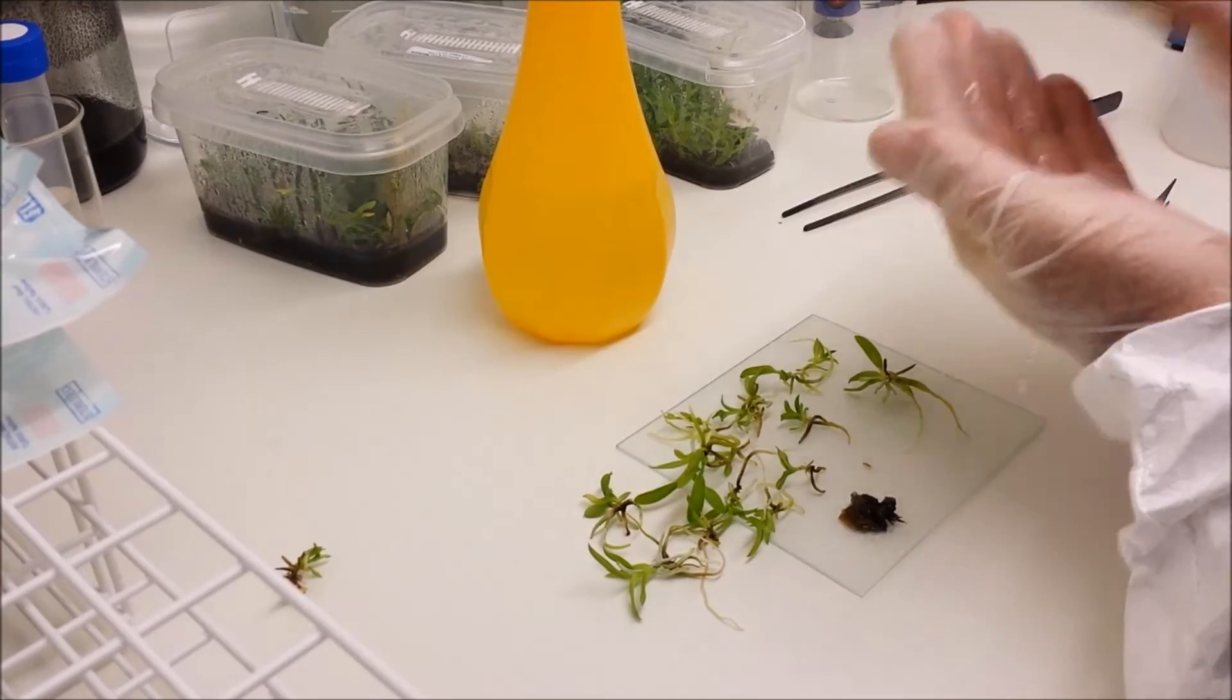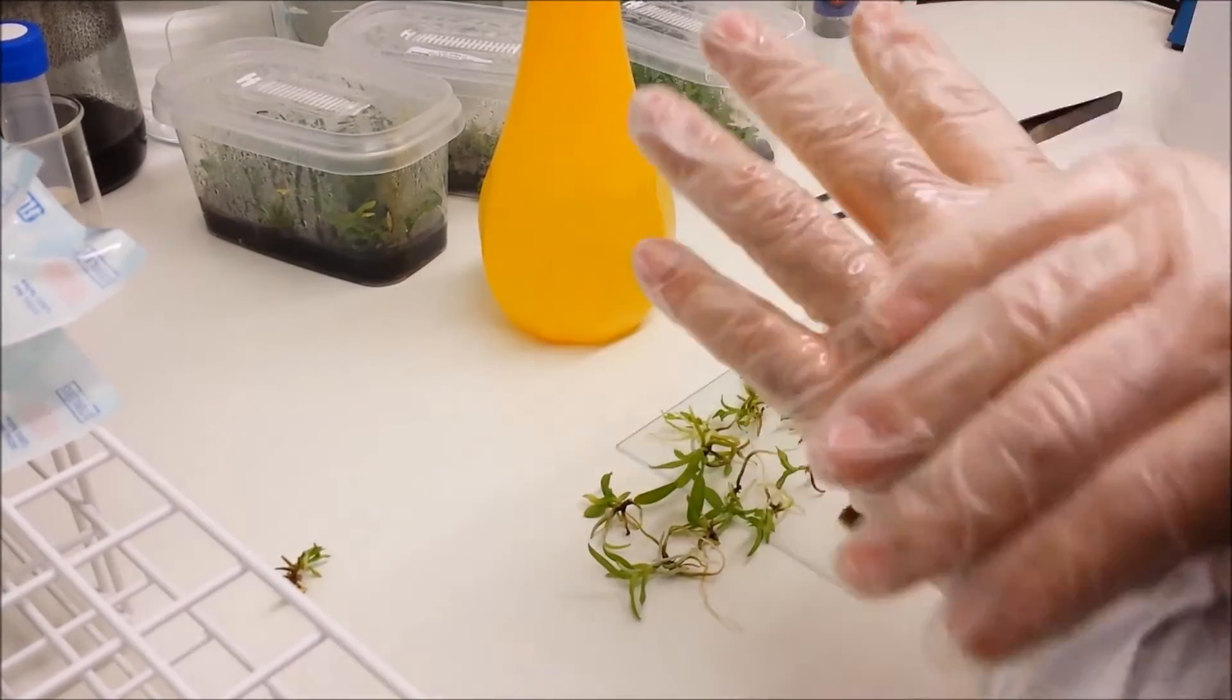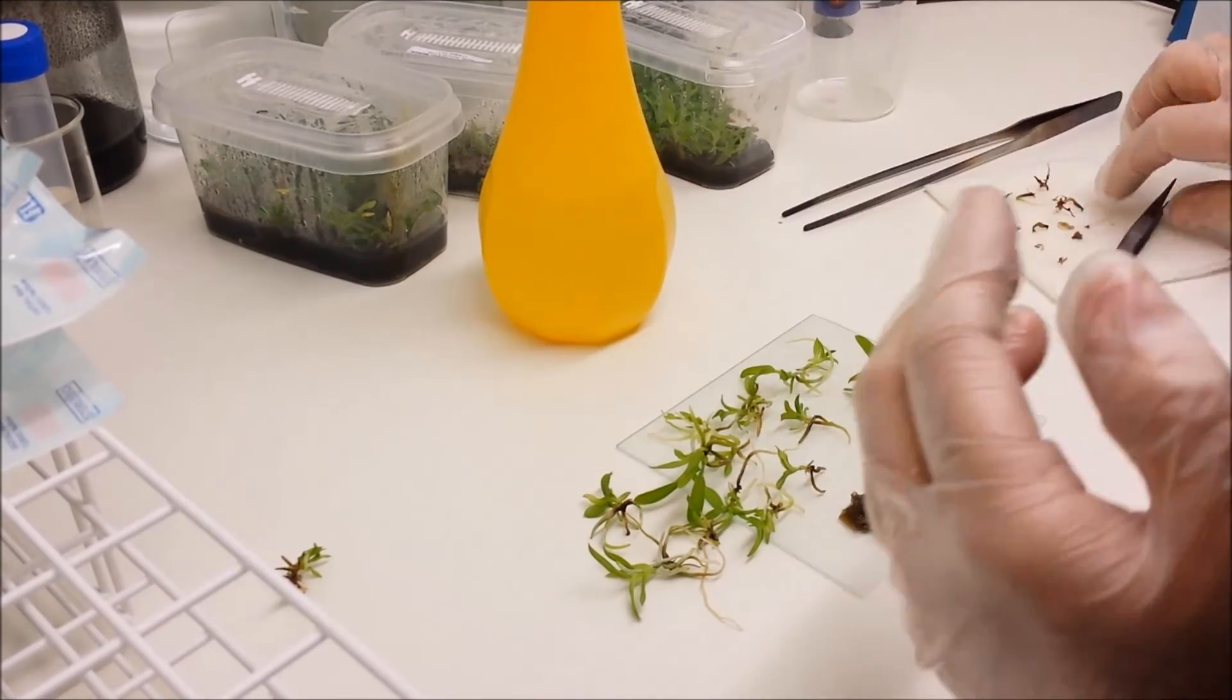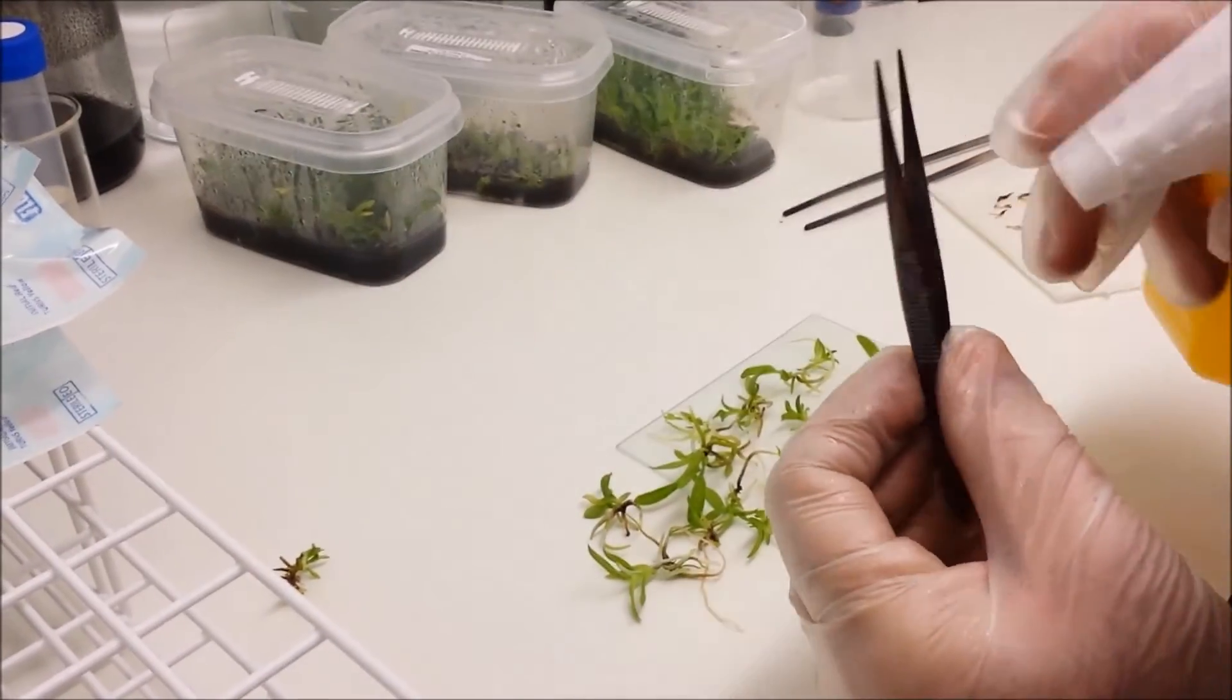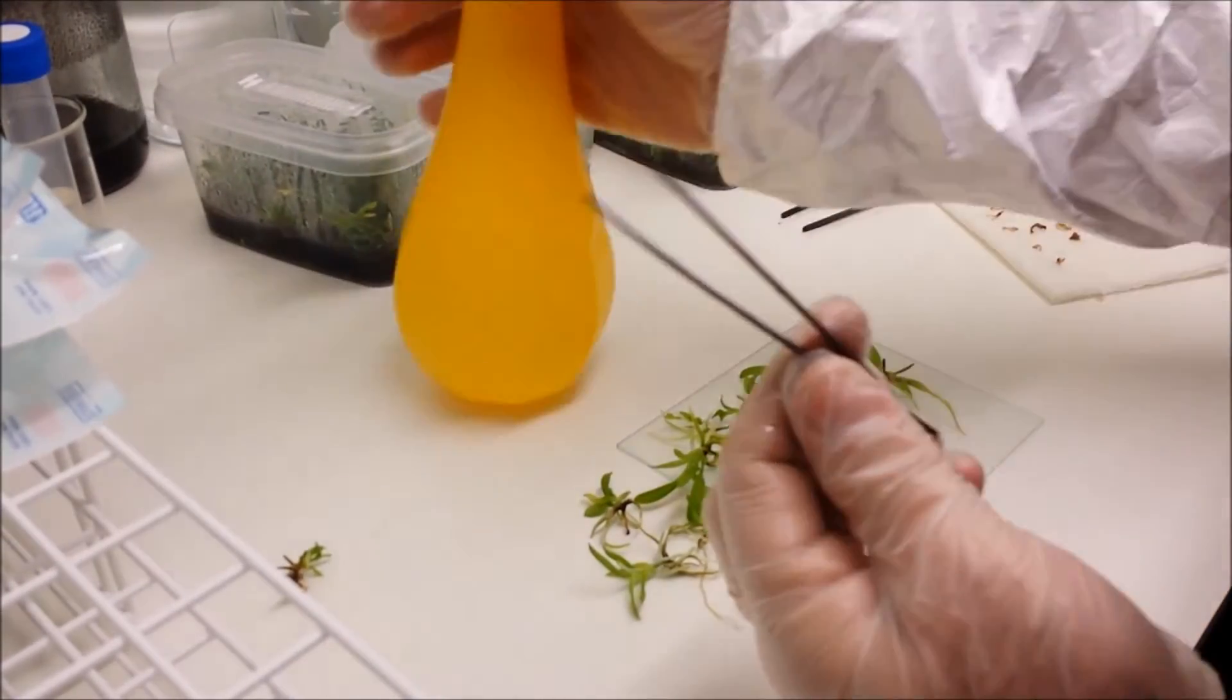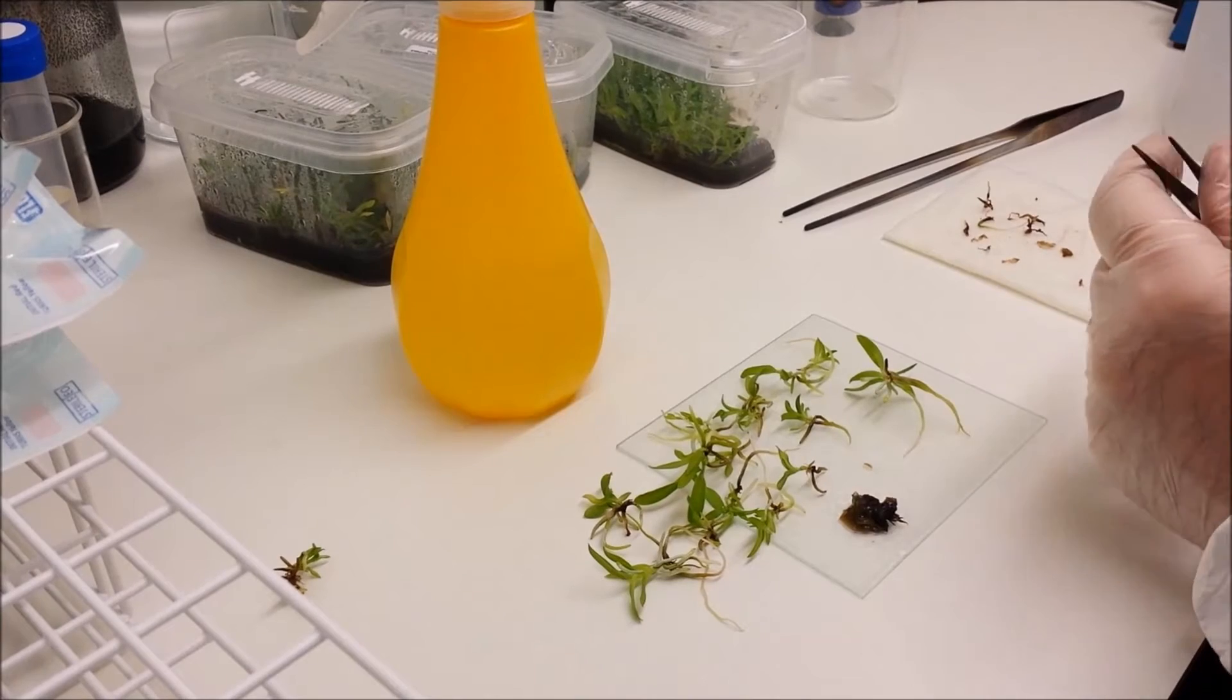Now I'm going to wipe some more IPA over my hands again just to re sterilize. And I'm also going to sterilize the tweezers and the forceps. Put them back down into tissue paper.